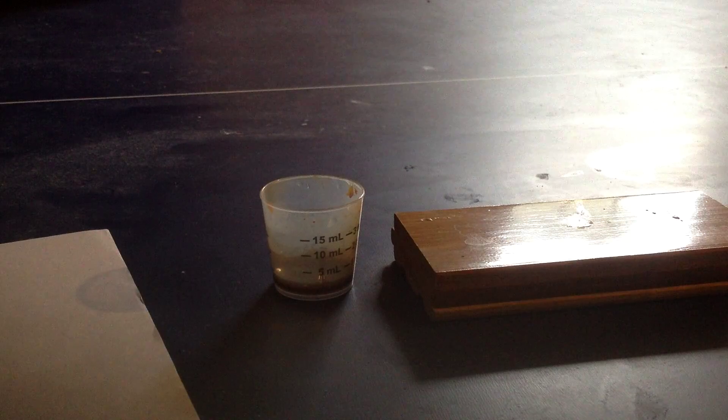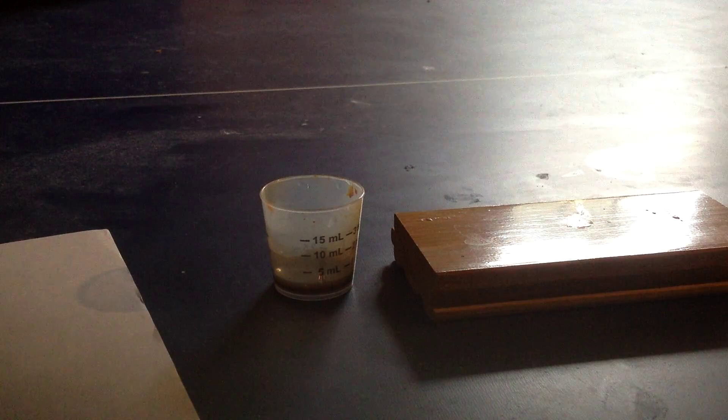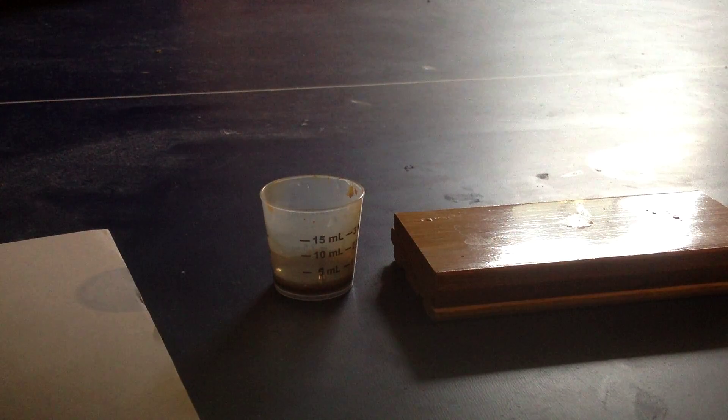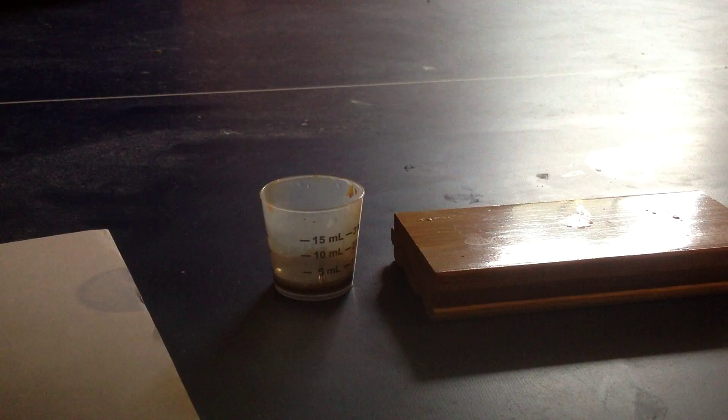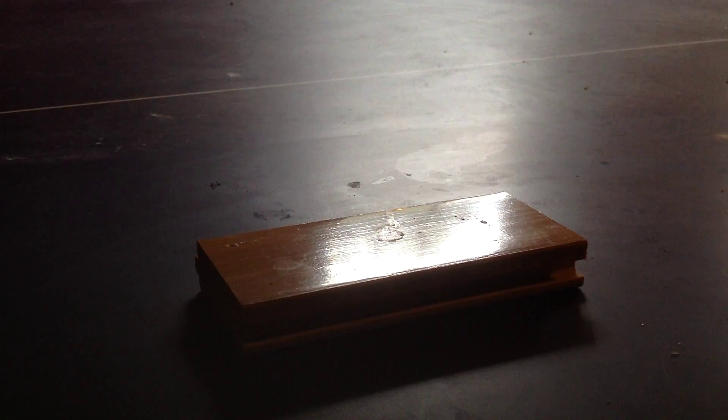So I decided to take the project farther and I'm gonna make my own magnetite. It's really easy and it's possible through electrochemistry which is my favorite branch because you can make almost anything from it.